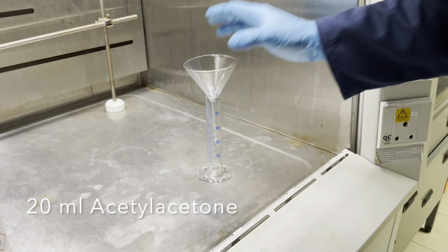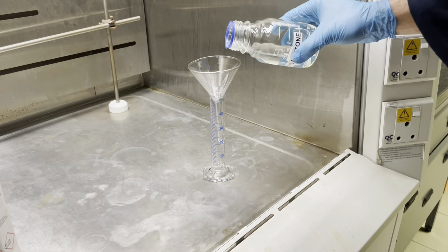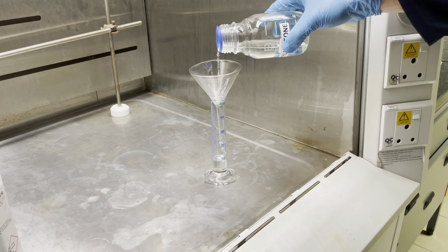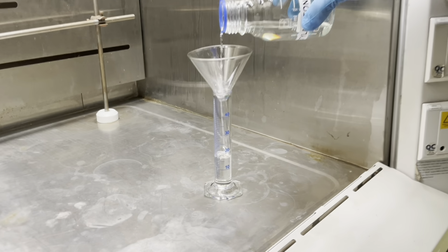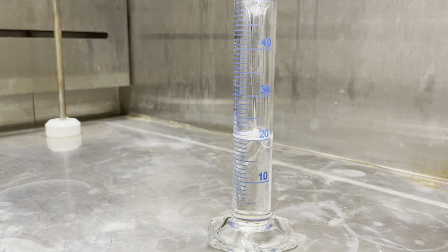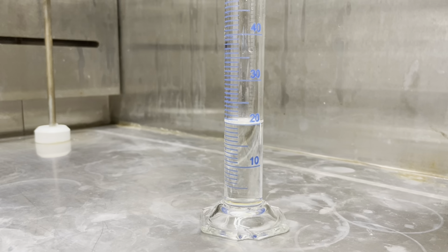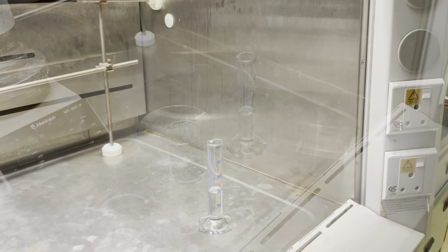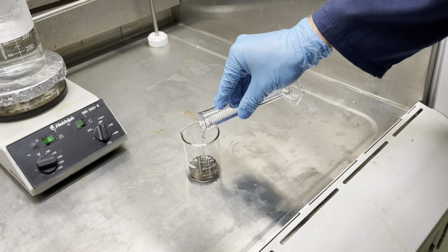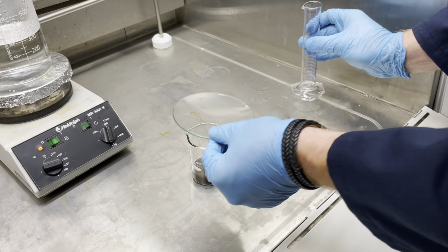Next, you will collect 20 milliliters of acetylacetone in a measuring cylinder and using a funnel in a reagent fume hood, as illustrated in the video. Next, in your fume hood, add your acetylacetone to your cobalt carbonate and slightly swirl the solution so that you can dissolve your reagents.